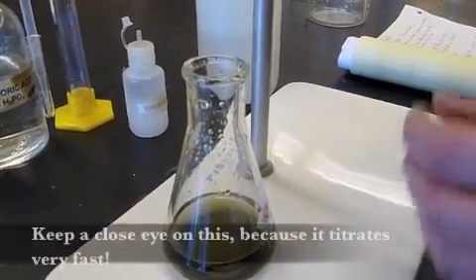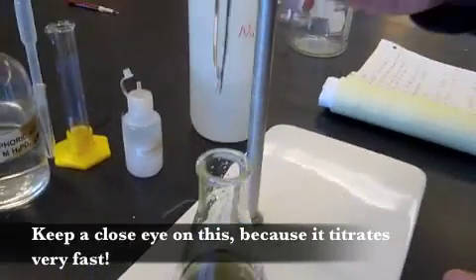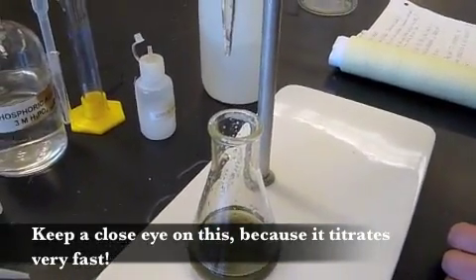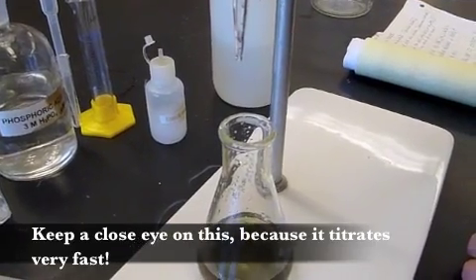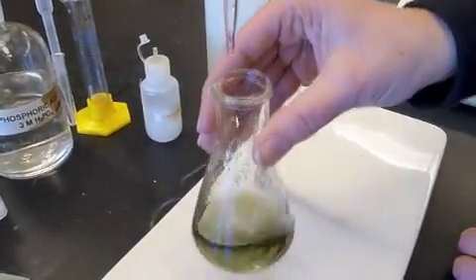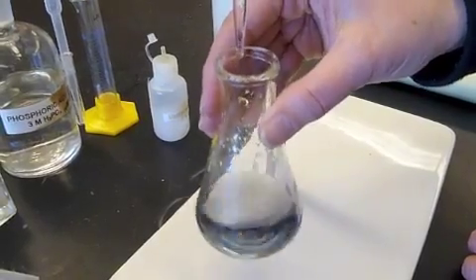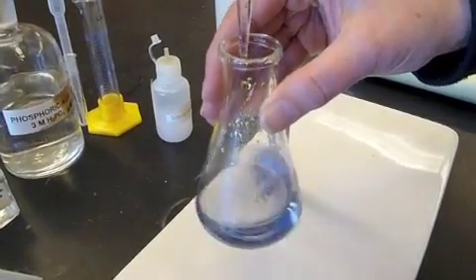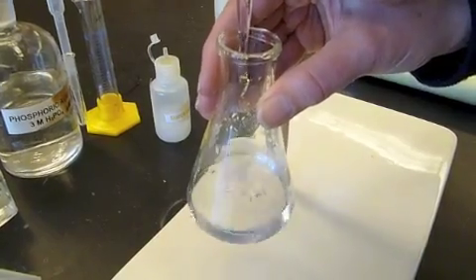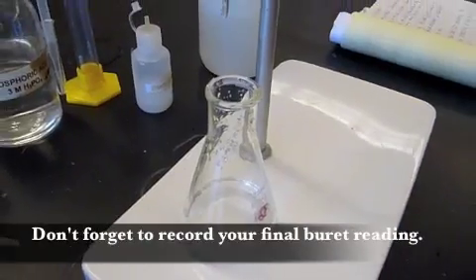Okay. Now this is where you need to pay attention a little bit. We're going to get it to be clear, so that it looks like water again. I'm going to do this with drops, just because I don't know when it's going to actually do the change. You can see it happening already, and there it goes. So that is our first titration.